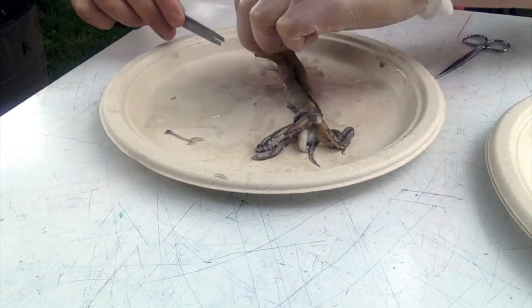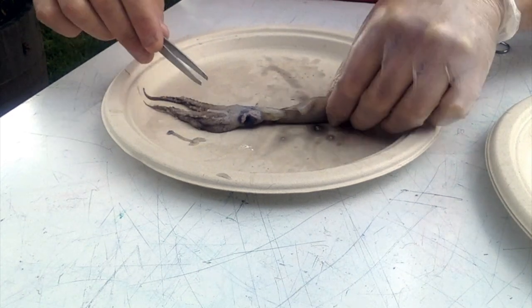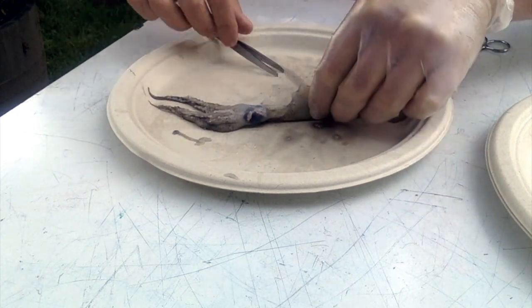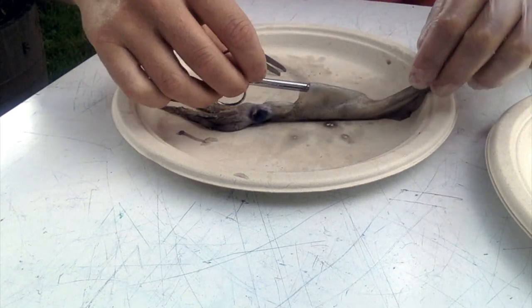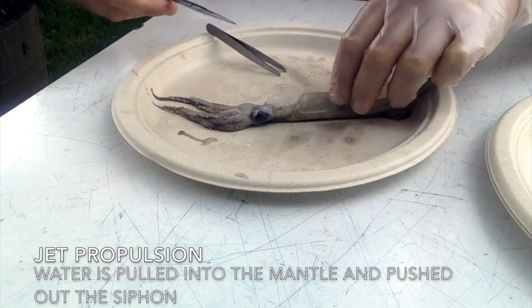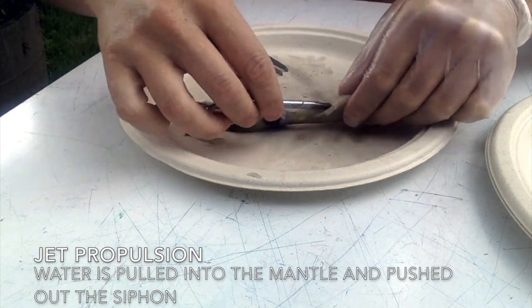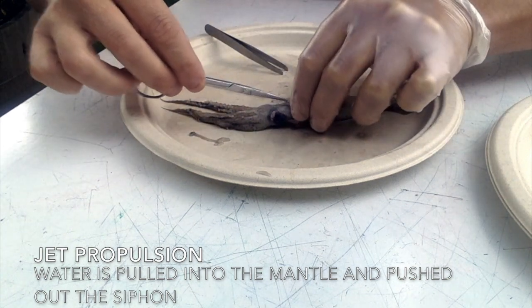So let's see here. Other important features. This is still the mantle. You can see in the mantle there's an opening. It's just wide open in here. So the way that the squid does jet propulsion is it pulls water into its mantle and then shoots it out the siphon.